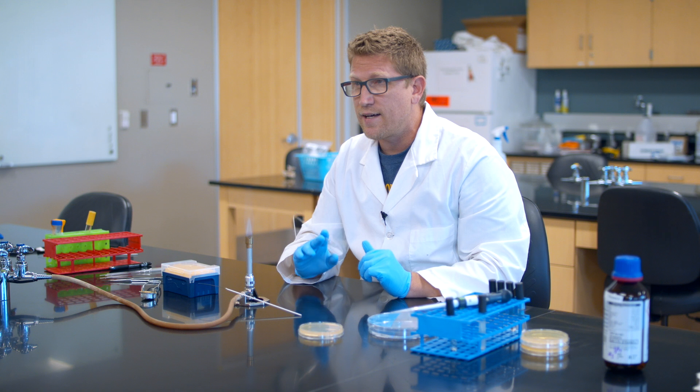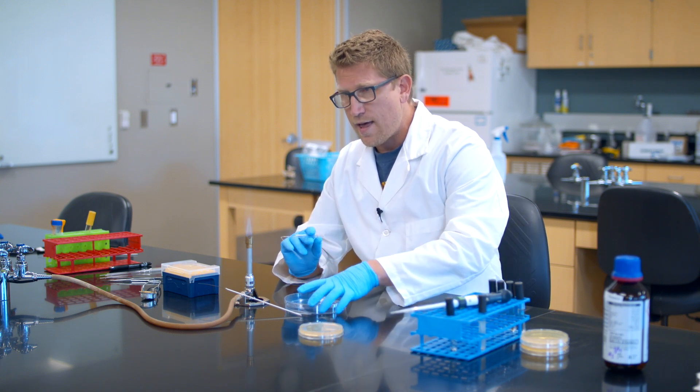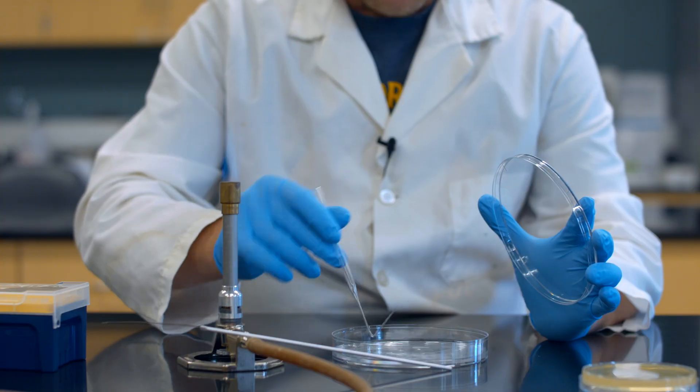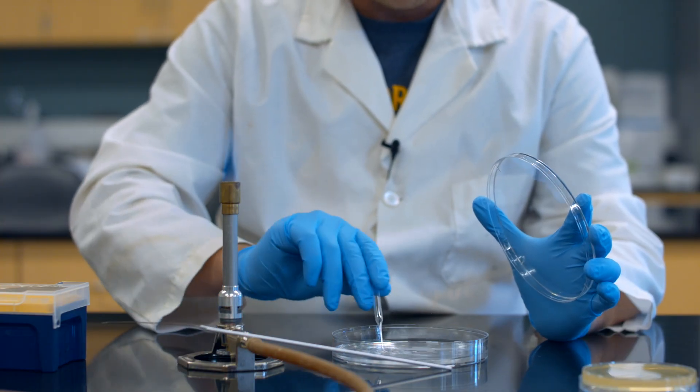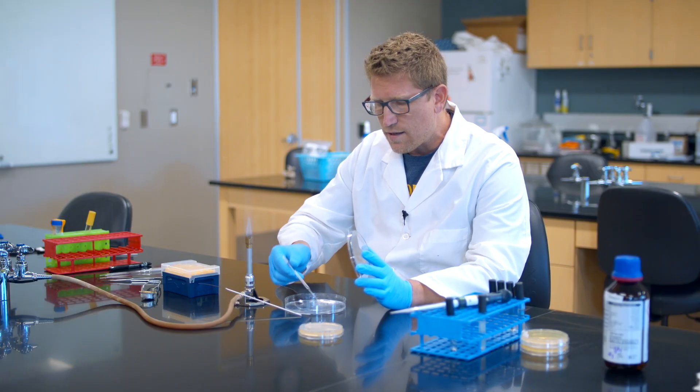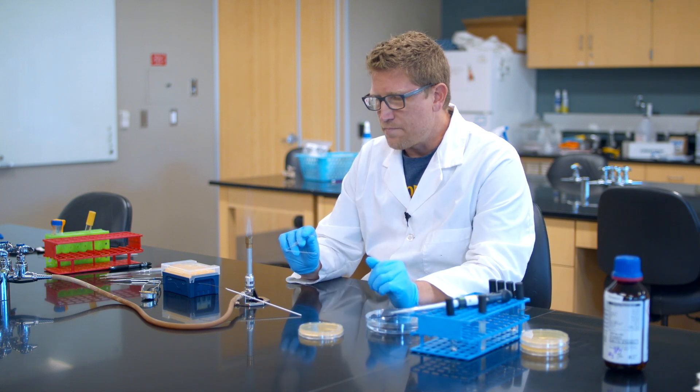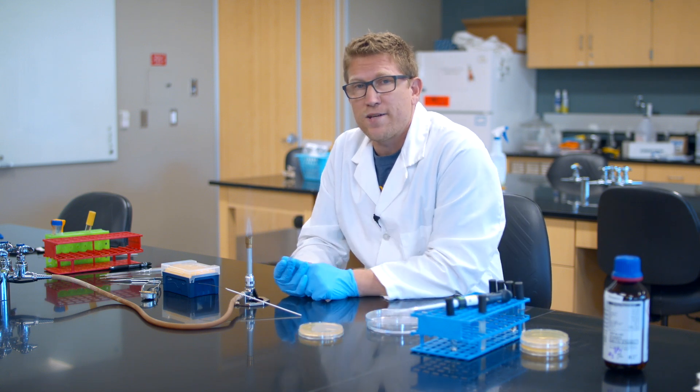So, am I done? No, because my glass spreader has E. coli all over it. So I'm going to bring my ethanol into the picture again. I'm going to kill the E. coli. Remember, it's not the flame that kills it in this case. It's the ethanol that kills all the bacteria that are on there. I'm going to shake it off, and then I'm going to burn off the excess ethanol. And at that point, I'm finished with my spread plate.